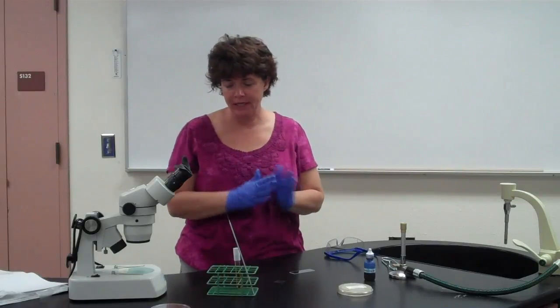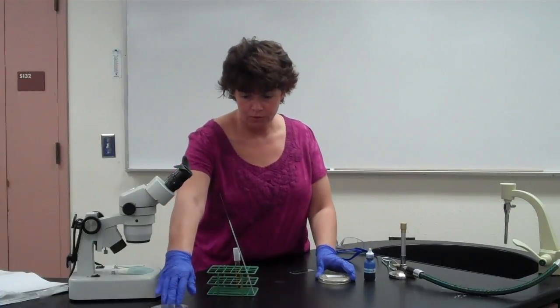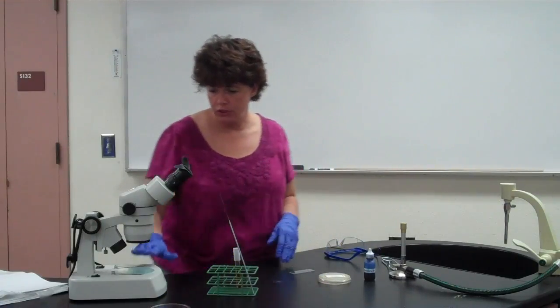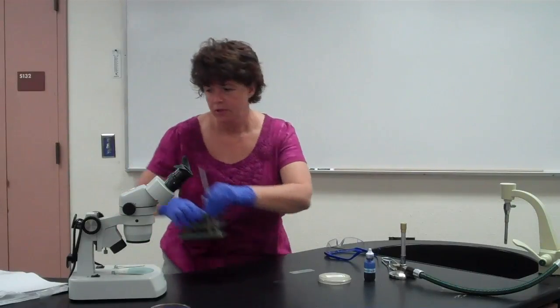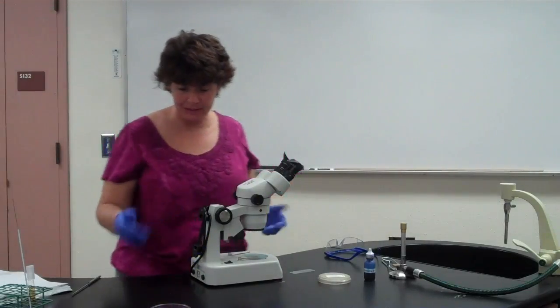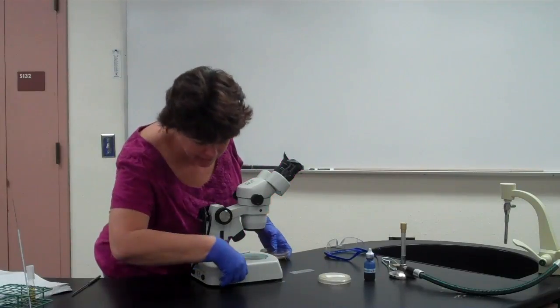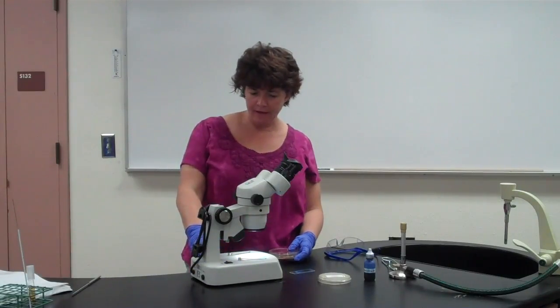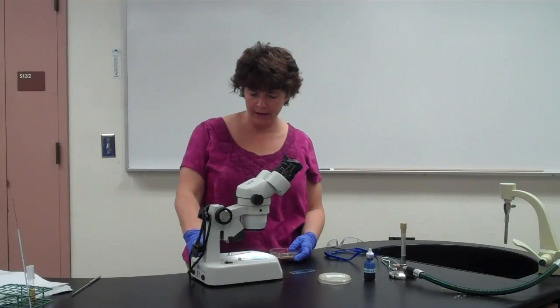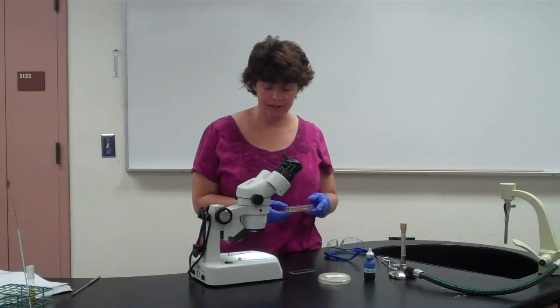So the second week, you're going to actually be looking at the plate that you grew. All right? So this time you're going to use the dissecting scope. It says to look at it with a hand lens. These work just as fine. These dissecting scopes, you may or may not have used them. Basically they have a main switch that turns the light on. And then they have two smaller switches here. One turns on the middle light, the bottom light, and the other one turns on the light on top. It's up to you which way you want to look at it. Be aware that there may be some condensation in the lid, so you may have to try to look around the condensation to see it.